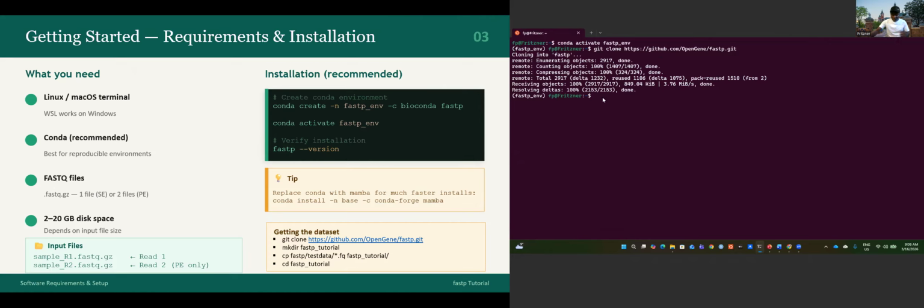Let's check if we have it. Yeah, the folder named fastp. We have the fastp, which means we successfully cloned the repository. So we can go inside the fastp to see what is inside.